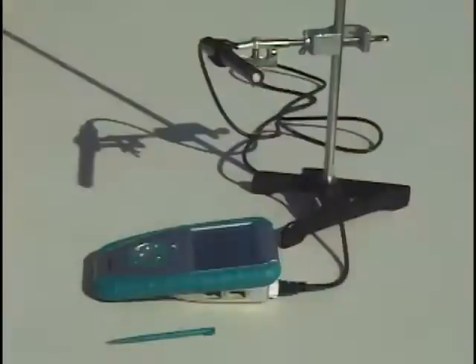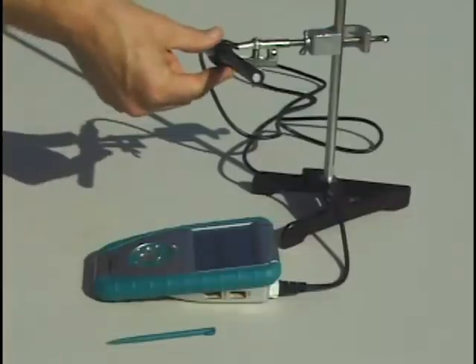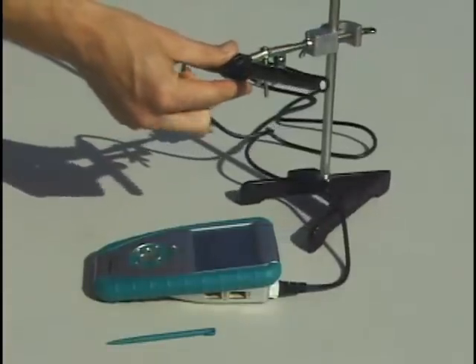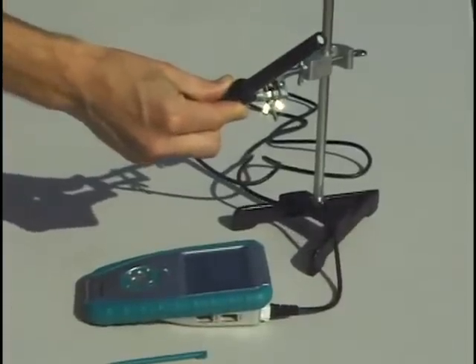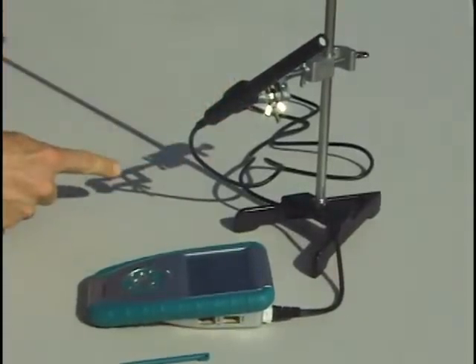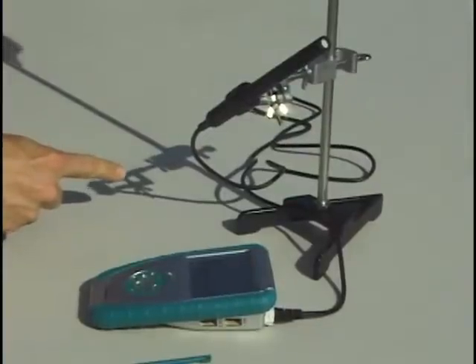The first thing we need to do is position the sensor so that it's pointed directly into the sun and make sure that we get good even lighting through the entire activity. The angle on the clamp lets us point it straight at the sun, and the way to sight it is to use the shadow until it goes to the smallest possible dot. That way we know we're pointing straight at the sun.